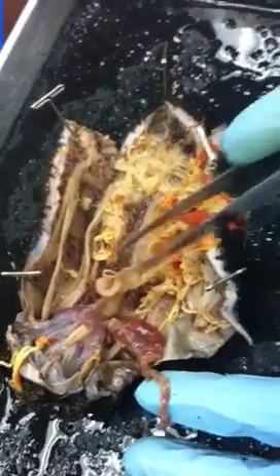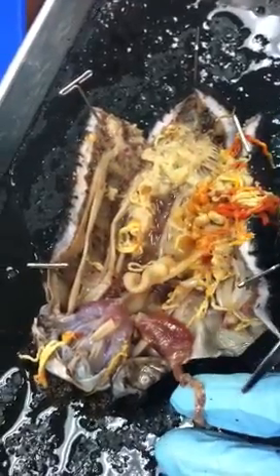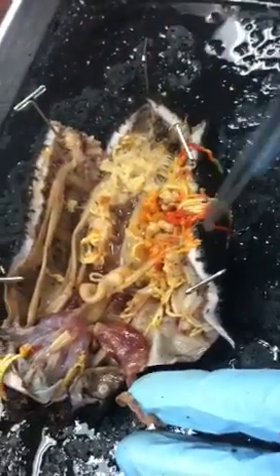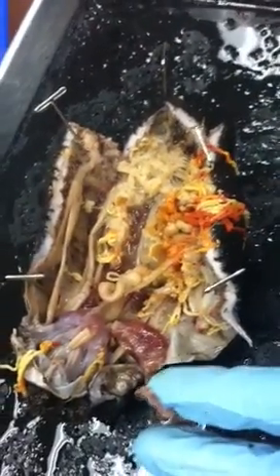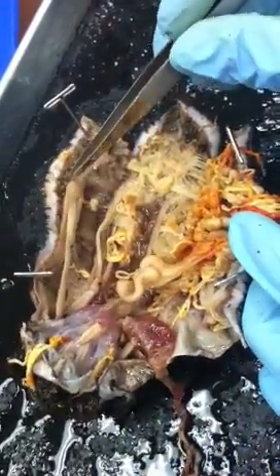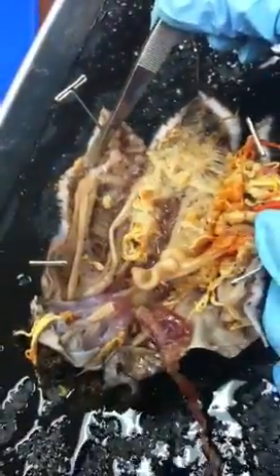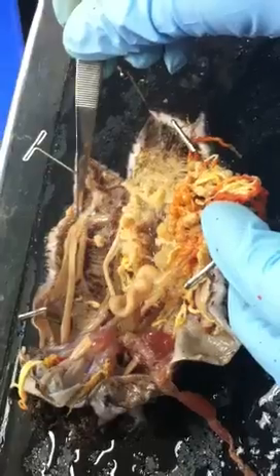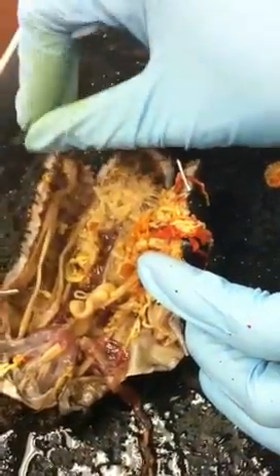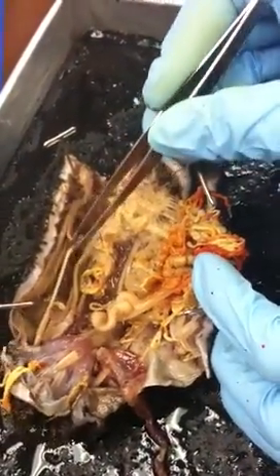So you can remember the stomach and intestine are going to come out straight down, and the Polian vesicle is going to be off to the side. Okay. So the only time that we can see the Polian vesicle in a real specimen is in the sea cucumber, but it is on the starfish model. So you'll know what it is. And then you can see the red ampulla here on the inside. You guys all see that? Okay. And then these guys are pretty muscular. They have the tube feet, and they also have ossicles, but they're really small and far apart. So they're basically worthless.